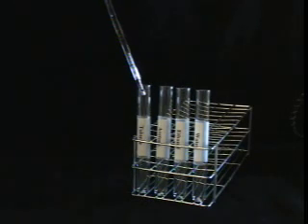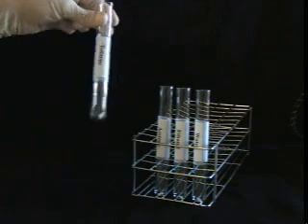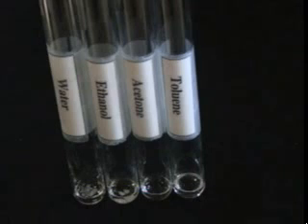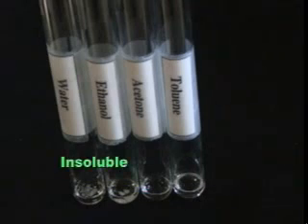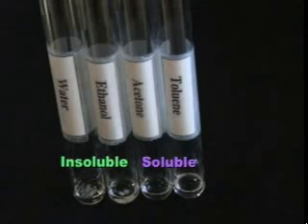To perform a solubility test, place approximately 20 milligrams of your compound in a test tube. Add half a milliliter of the appropriate solvent and swirl. Wait a couple of minutes and then make note of whether or not the compound dissolves. For example, at room temperature, naphthalene is insoluble in ethanol and water, but soluble in toluene and acetone.